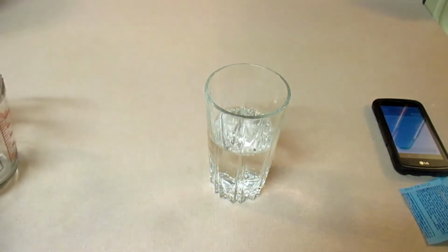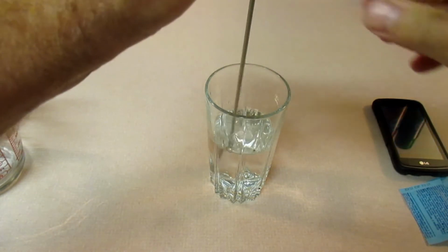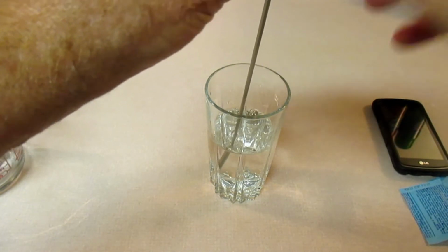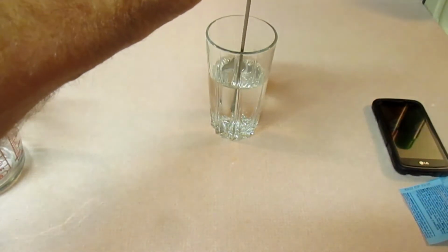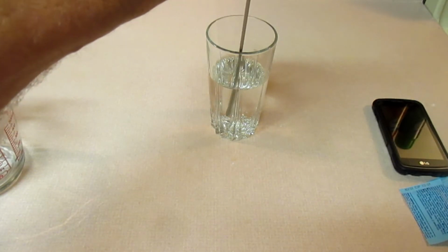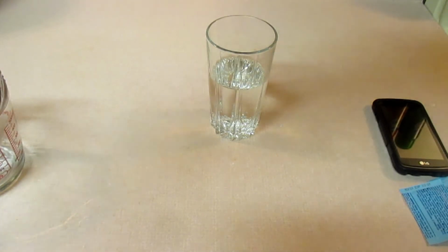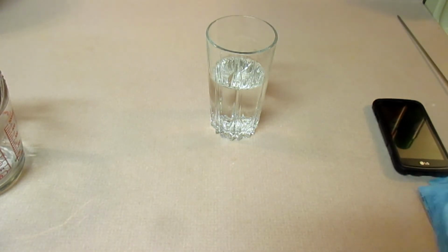All right. I'm then going to use my thermometer and record the temperature, and unfortunately you can't really see it, but it is reading about 22 degrees Celsius. So not all that cold. I probably could have run it longer so it gets colder. But I would take that temperature and then record that in the table in the lab.